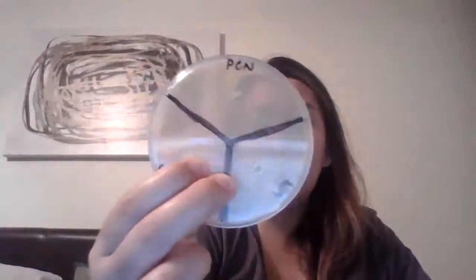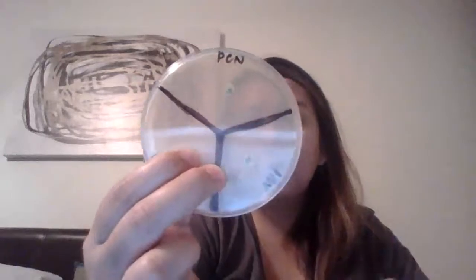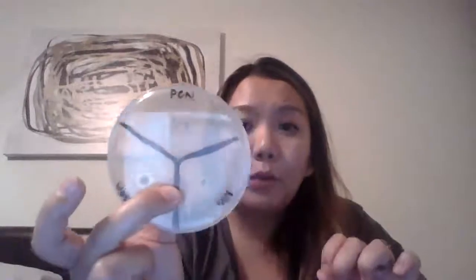With penicillin, you can also see a little bit of growth inhibition. There is a small circular area, though it's not as defined as gentamicin's. So I would say this would be considered intermediate sensitivity, whereas gentamicin is sensitive.